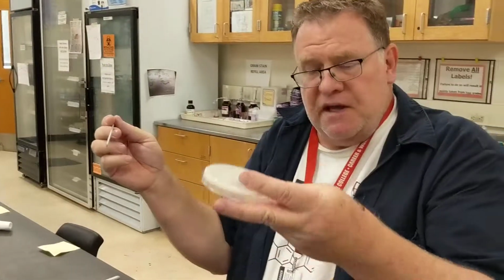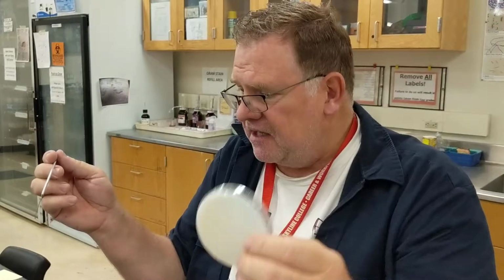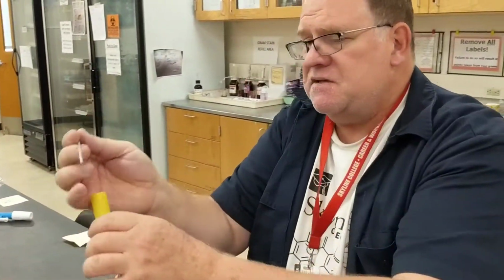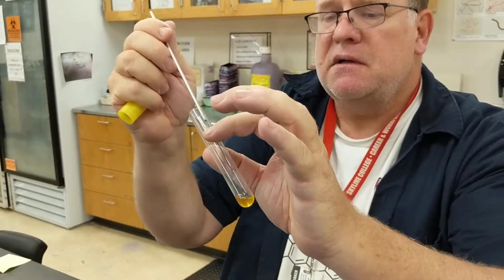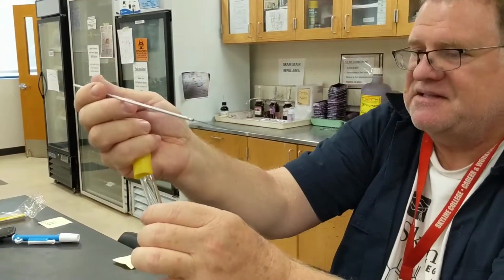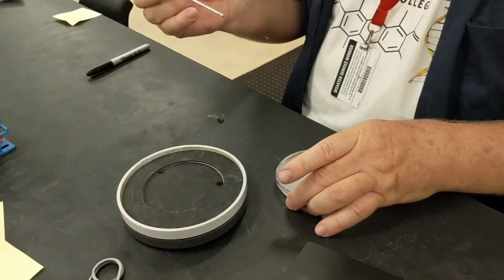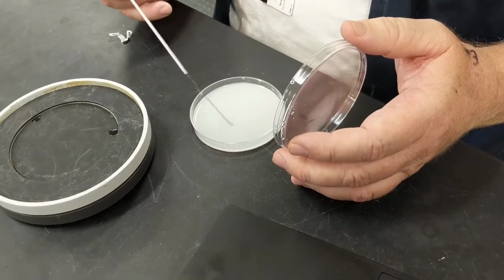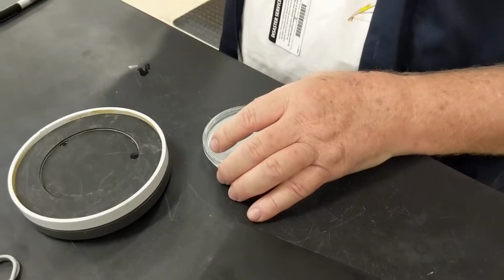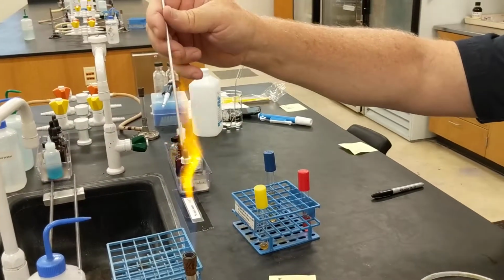The next thing that we're going to do is what we call a starch plate, and the white color here is due to the starch that's inside the media. Then I'm going to get my inoculum on the loop. Flame it, put it back. Then I'm going to make my inoculation. You can almost do a lazy S on there, but when I have a plate, I always streak out a plate for single colonies.